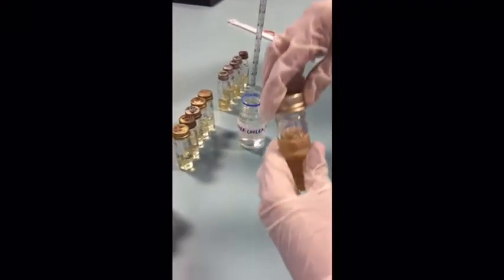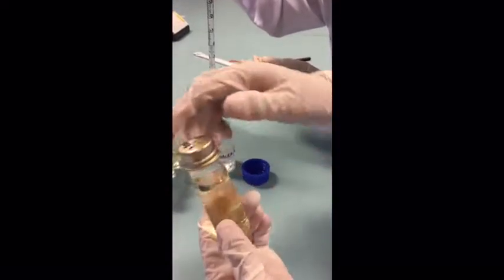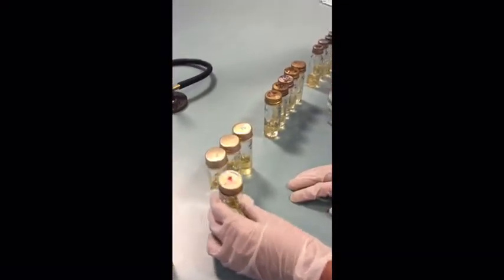If there is any presence of bubble in the water in the sample, we have to shake the tube to remove the bubble. The step is repeated for the following 4 tubes.